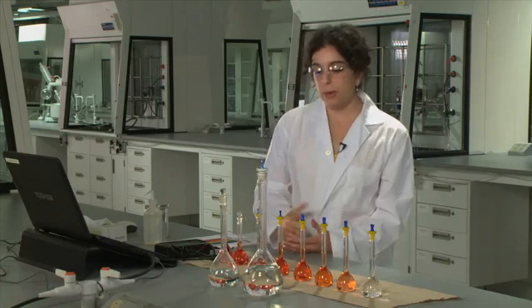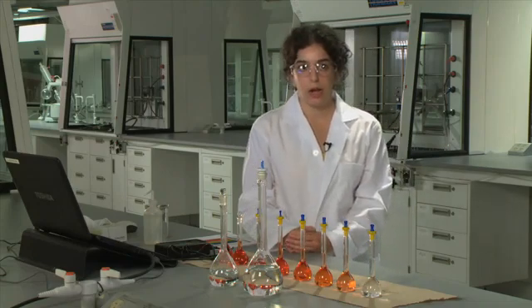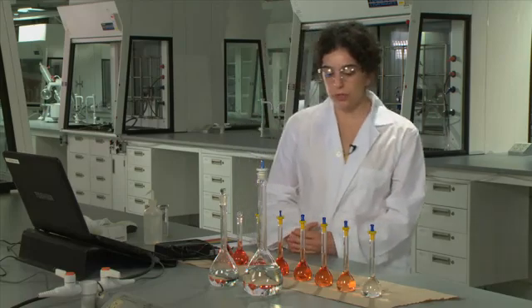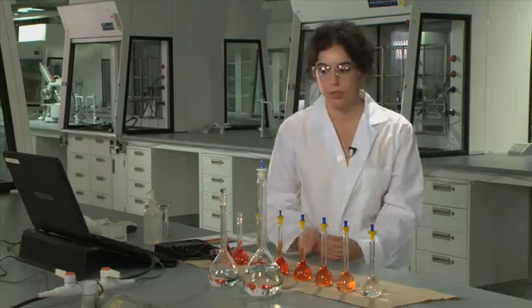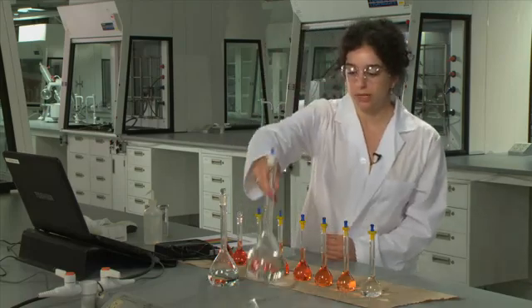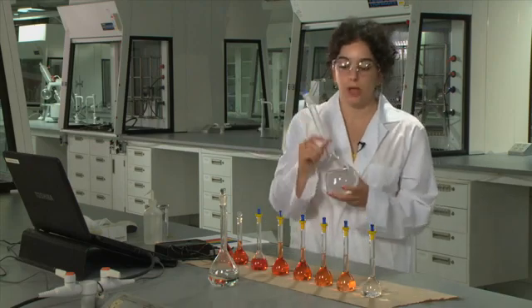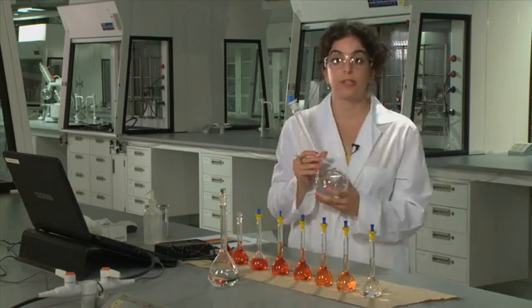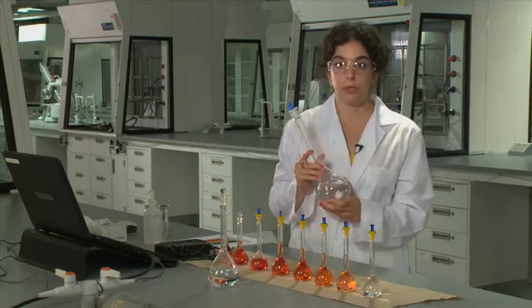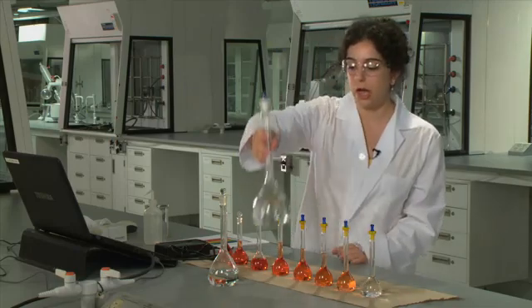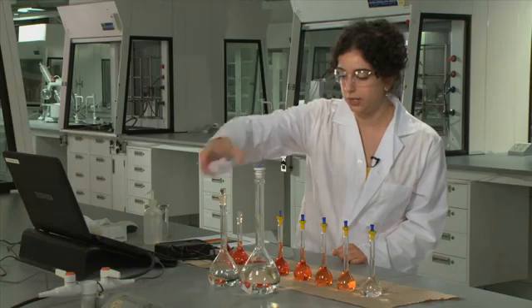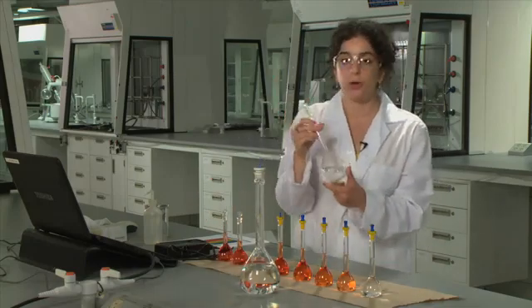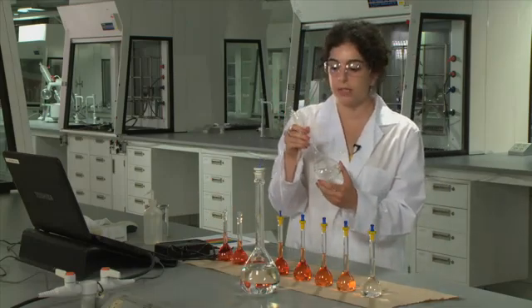In this experiment, you're going to be preparing various solutions. There are two groups of solutions. One will be a standard iron solution that you'll prepare in a 500 milliliter volumetric flask. This contains a known amount of iron. The other flask that you will prepare is the unknown sample, and that will be done in a 250 milliliter volumetric flask.